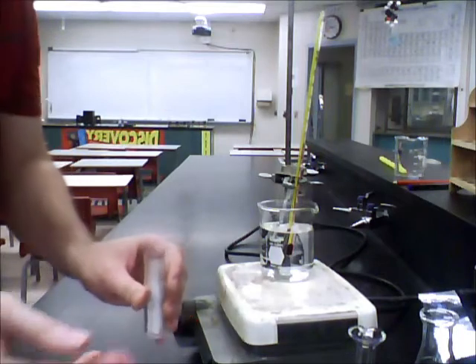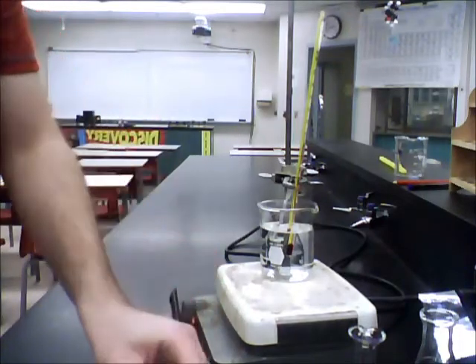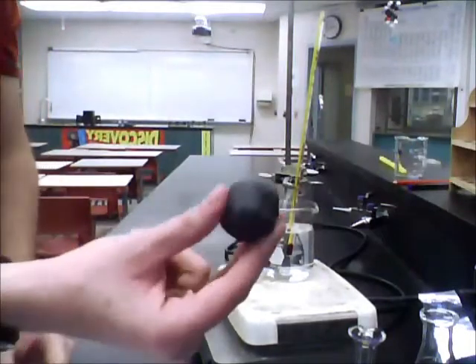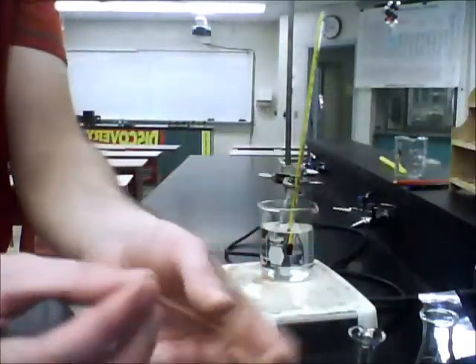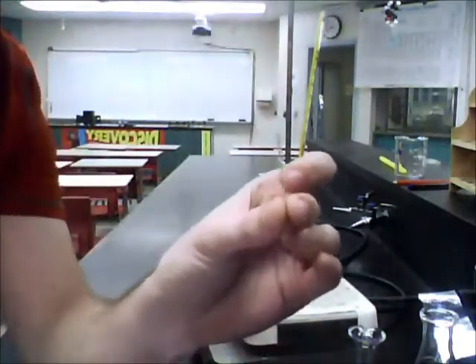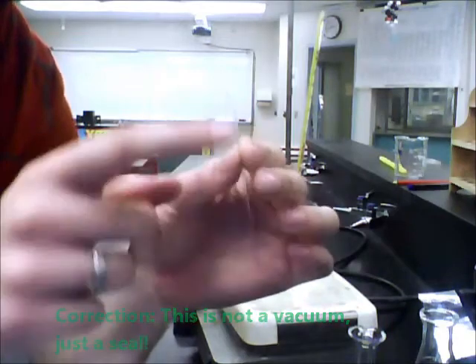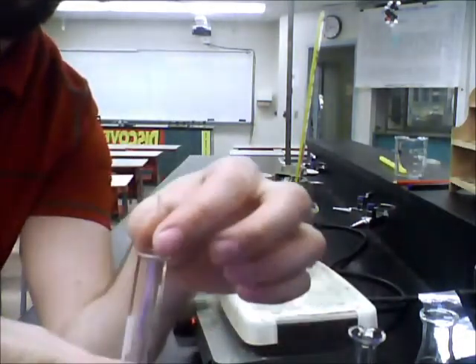I'll have enough time to show you how this whole capillary tube will work. In your instructions, it will say that we have a closed end. What we're going to do instead is have an open-end capillary tube so both sides are open on either end. An easy way to get around that is to get a nice big ball of plasticine. Essentially, all you have to do is stab inside, pull out, and you have a nice little piece of plasticine clogging one end. If the plasticine is clogging this end here, it's sealing it shut and going to create a nice little vacuum at the bottom. I'm going to put the closed end facing up and the open end facing the bottom. When you actually get your test tube, all you have to do is drop it in. Once again, that's a closed top facing up. You're just going to drop it right in ever so slightly and it will rest inside your test tube.